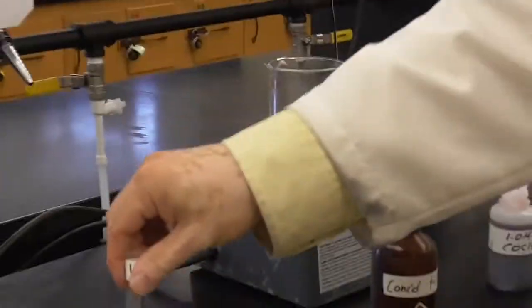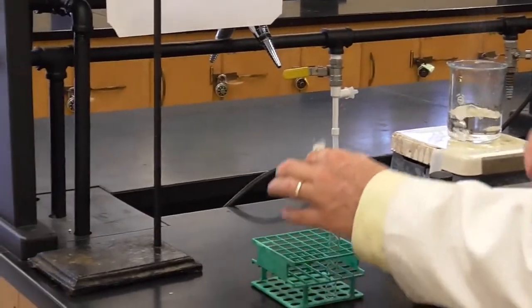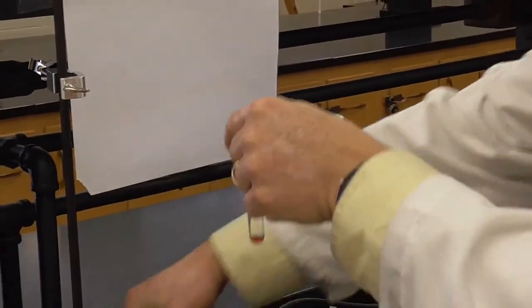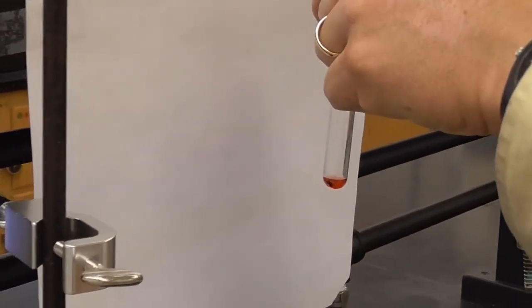Okay. Now, we will add the hydrochloric acid until we see a color change. So I guess I'll hold this up here. Hopefully you can see. Is this in the way? Maybe make that a little easier for me. Okay. Adding the hydrochloric acid is a good source of that Cl-.